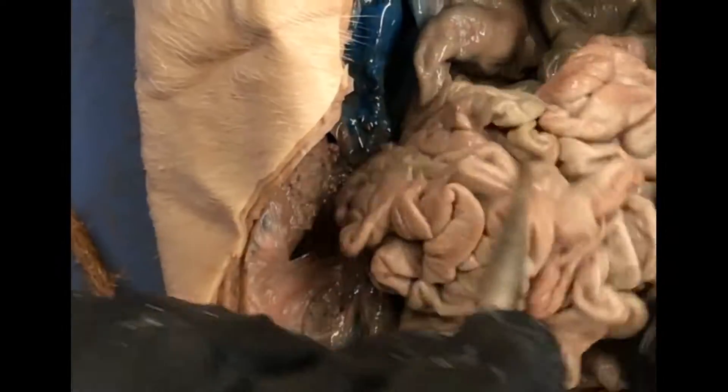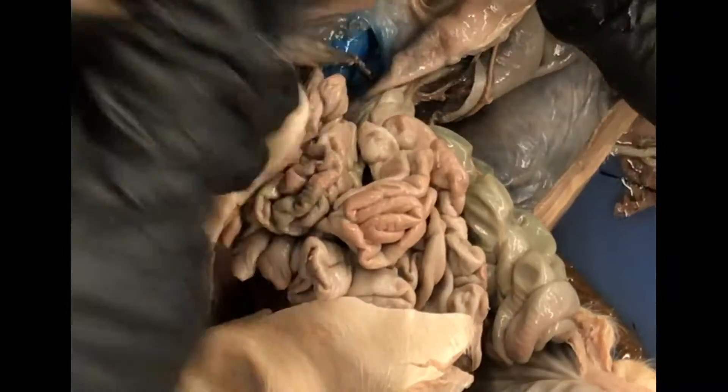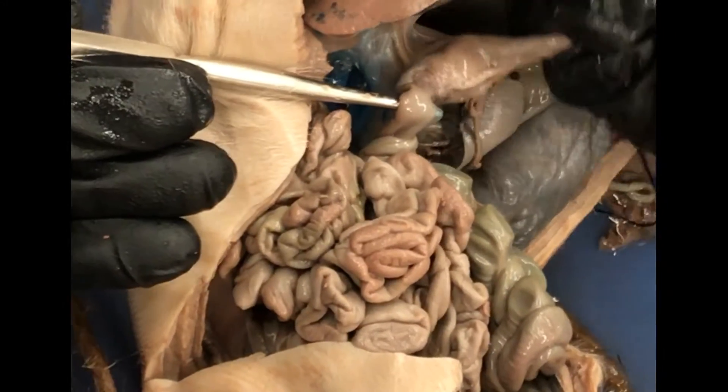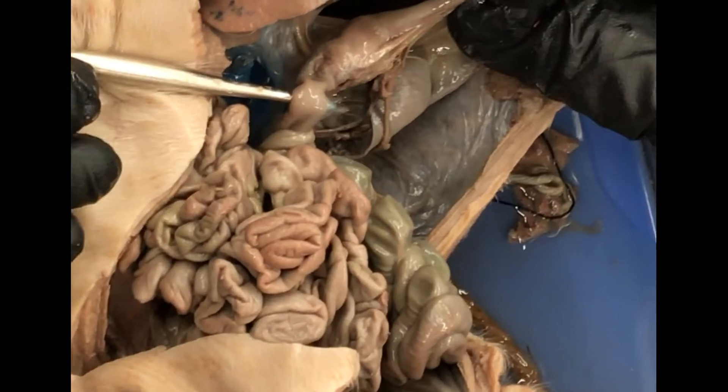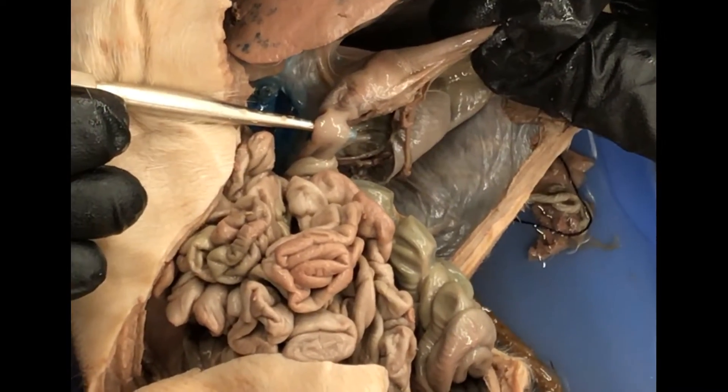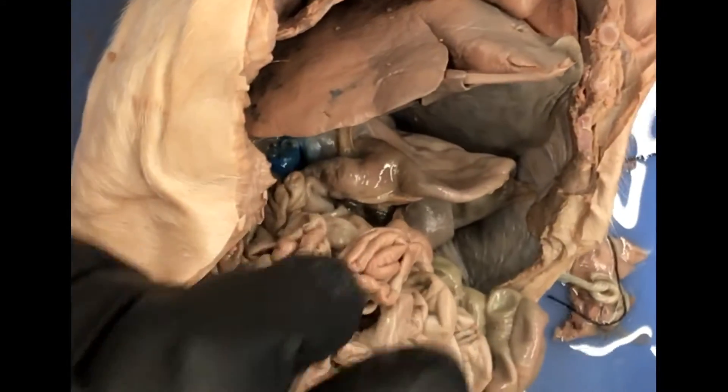If I'm pointing to a section of the small intestine and you can clearly see that it just left the stomach, that's the duodenum. And if I'm just in the middle, just say jejunum — there's no real other way to tell.